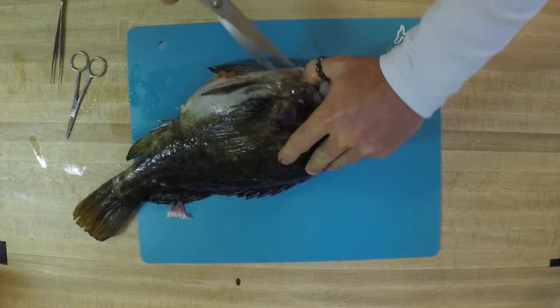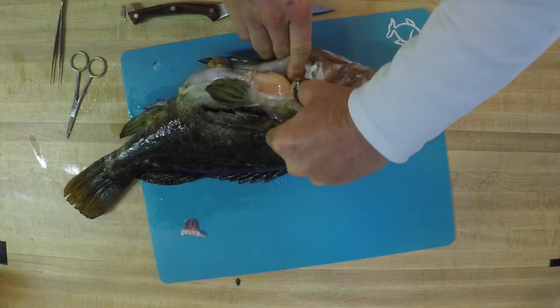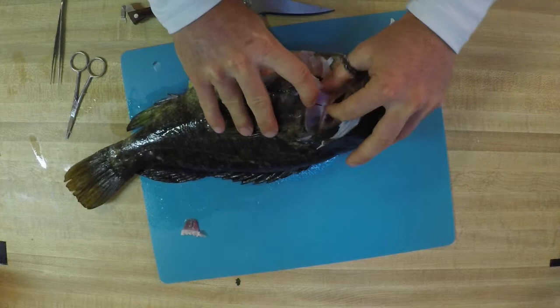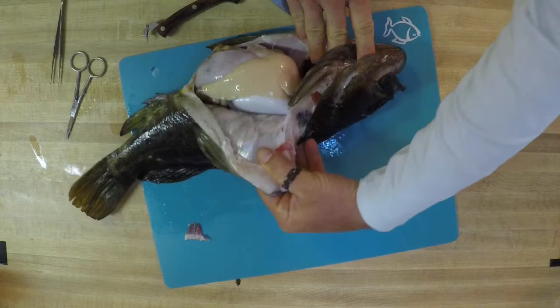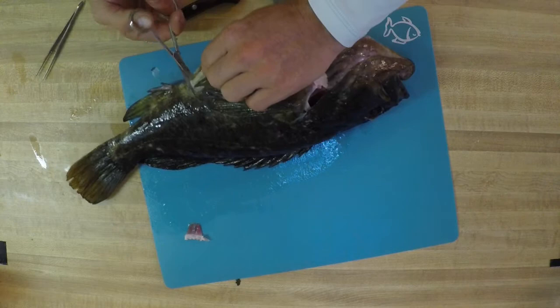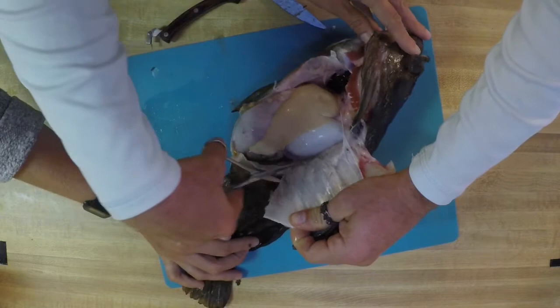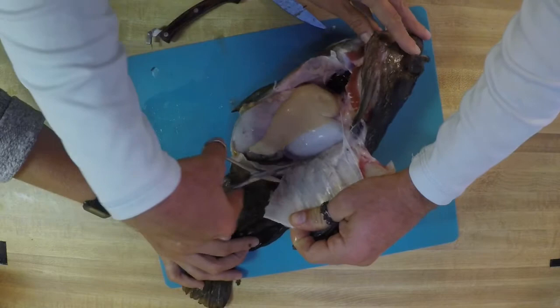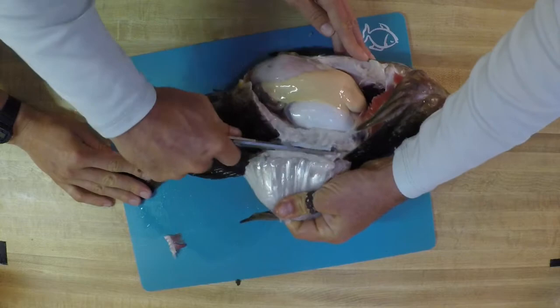It might jump around a little bit. We'll open it up and cut a little bit higher to create that window — that little membrane is holding it together. Then we'll take our smaller scissors back and cut a little bit of this back area so we can create a better window to really see what's going on inside. We're just going through those ribs right now that protect these very, very vital organs. Go ahead and pause your video and just be very careful and start opening up your fish.